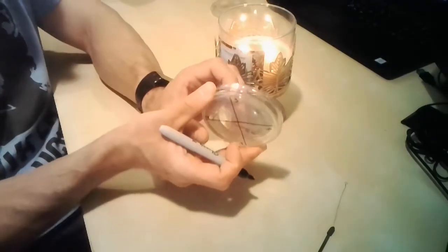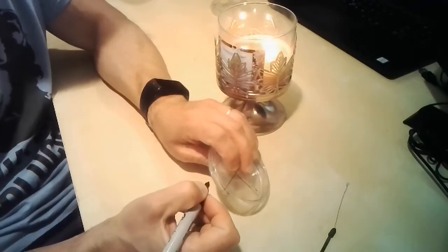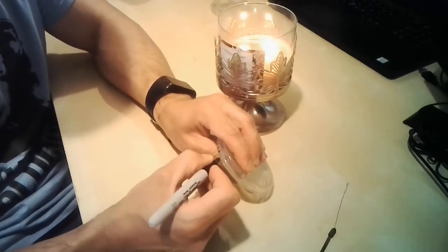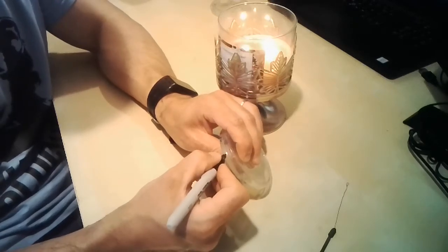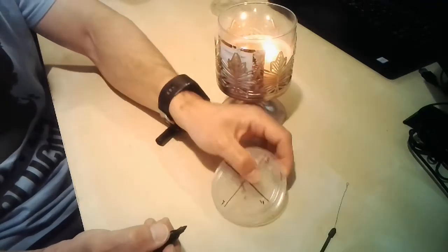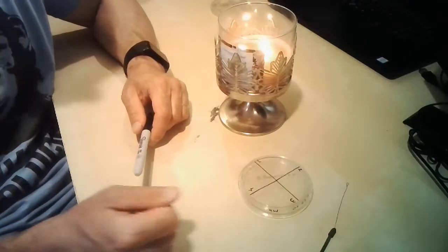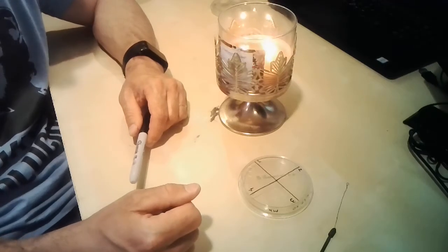We will also, on the side of the agar plate, write down today's date, which is 5/26/20, and I'm going to put my initials, although I have no idea why, because nobody else is working here, obviously. So these 4 sectors will represent 4 individual fomites.